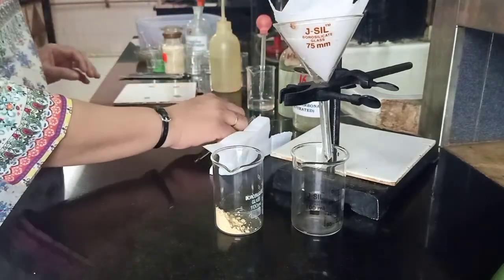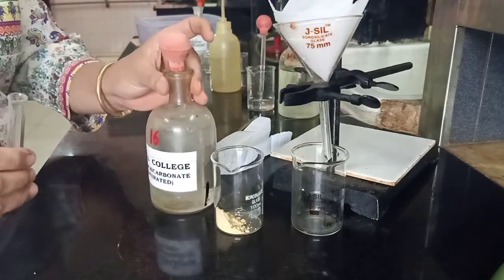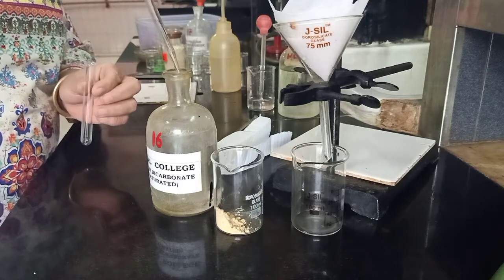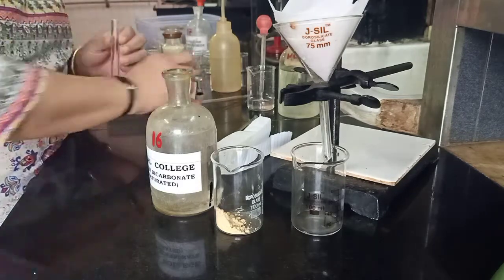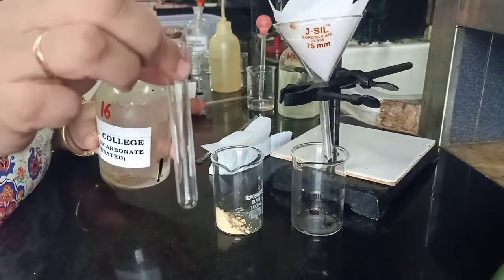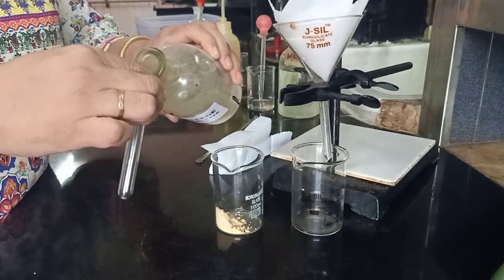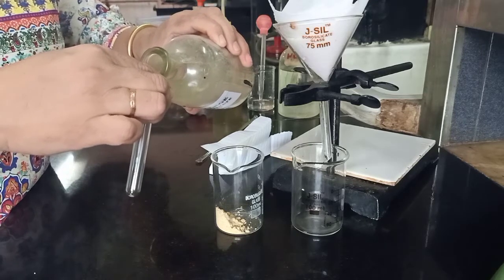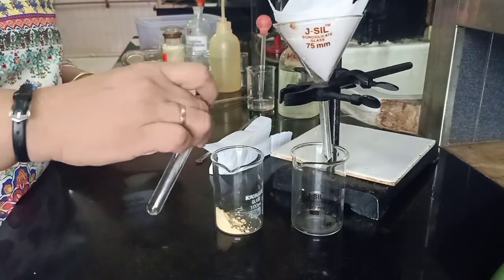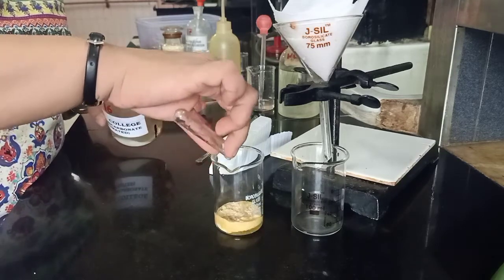We will now add our separating agent, which is sodium bicarbonate. The mixture given to you could be anywhere between one gram to two grams, so to be on the safe side we are going to add about 15 to 20 ml. This is a 10 ml test tube, so I will add about two test tubes of the separating reagent, which is sodium bicarbonate for today. Add it slowly — remember there will be brisk effervescence and it might bubble out.